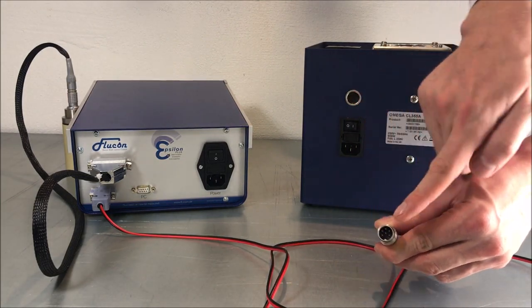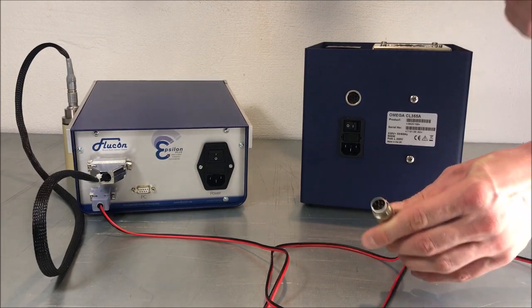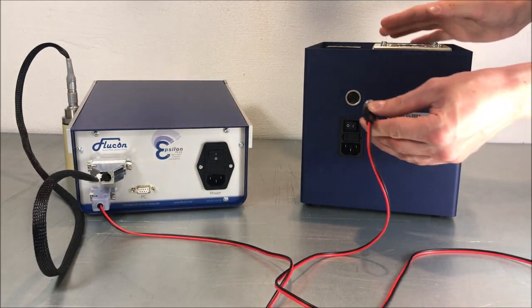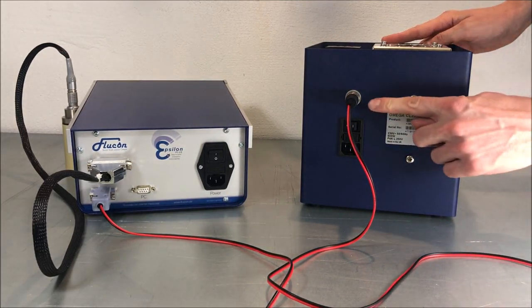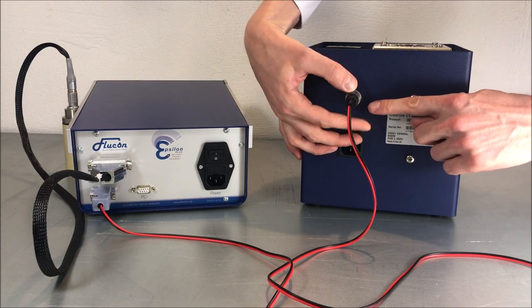Now the other ending of this cable should have its tiny metal pin facing downwards before you plug it into the thermostat. Use the cap screw on this plug to tighten it as well.